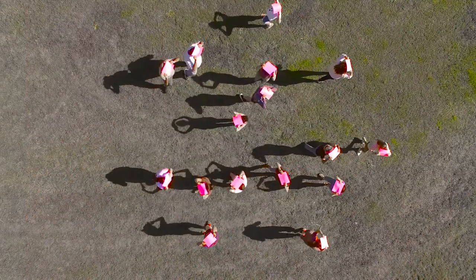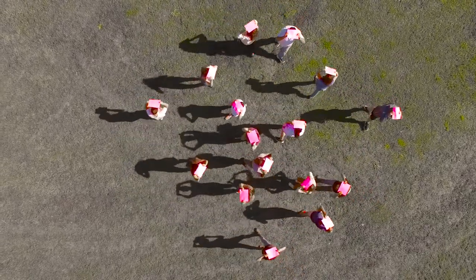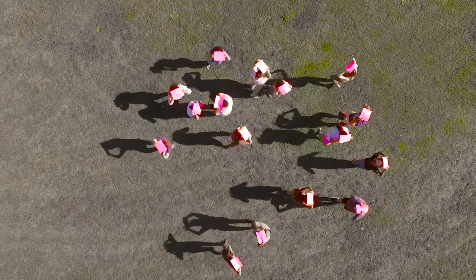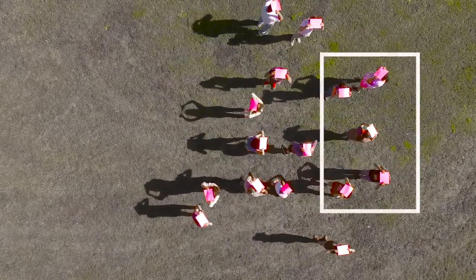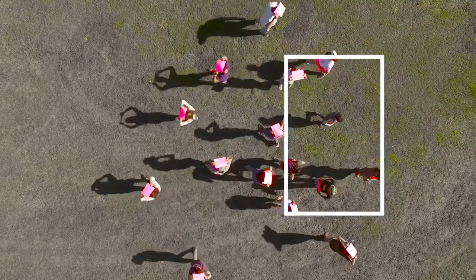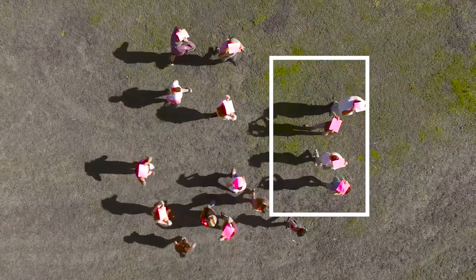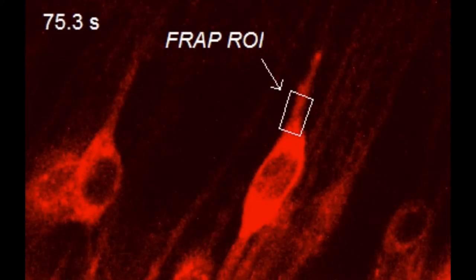To visualize what's happening inside the cell during a FRAP experiment, imagine that each person in this field is one fluorescently labeled protein. If the proteins are cytoplasmic, then maybe they're just diffusing around in the cytoplasm. If a scientist suddenly bleaches this region of the cell, the proteins are still there, but they don't fluoresce anymore, so that region of the cell looks dark. But since all of the proteins are still diffusing around, the proteins that are still fluorescent will eventually diffuse into the region that was bleached and make it bright again. In a cell, after photobleaching, the fluorescence quickly recovers.